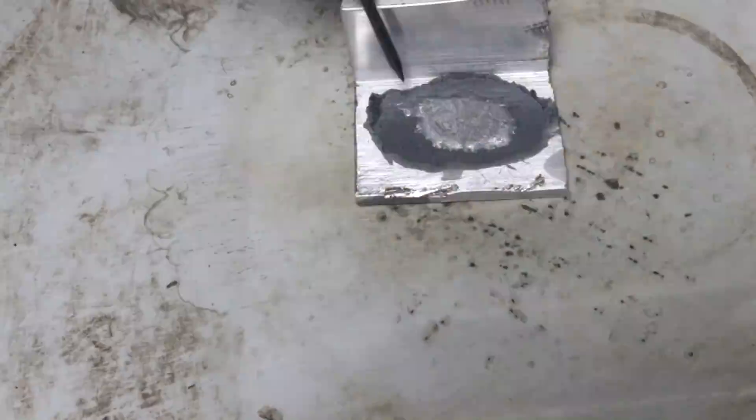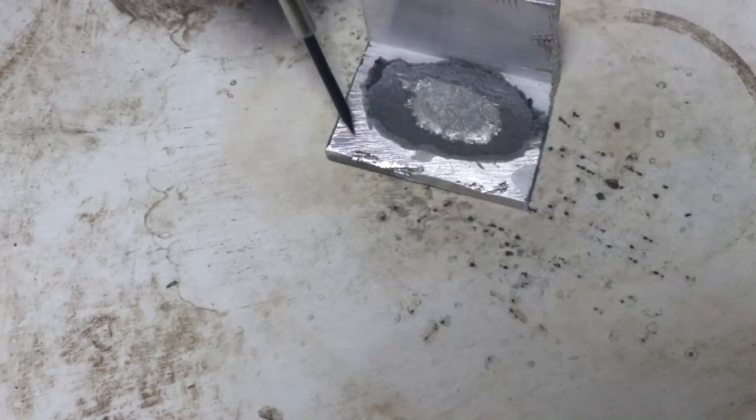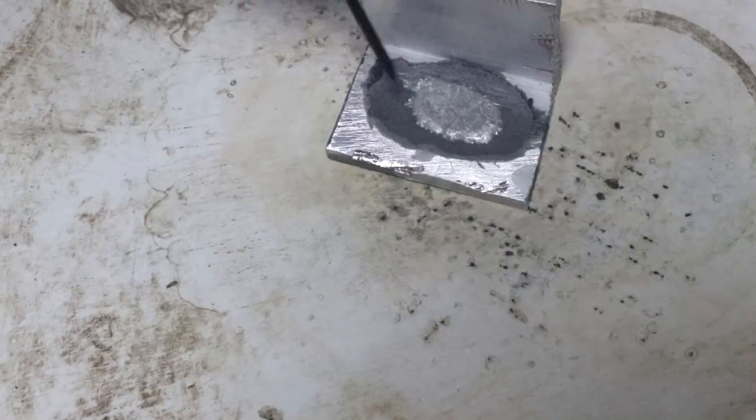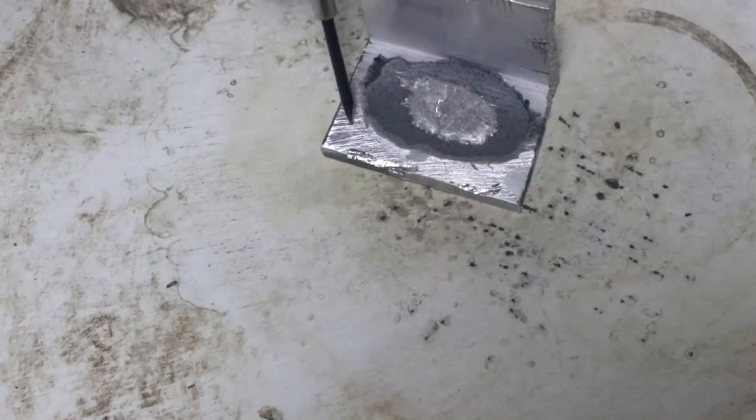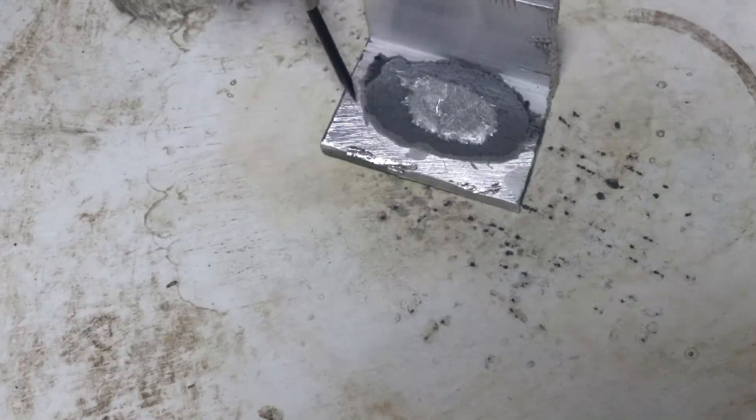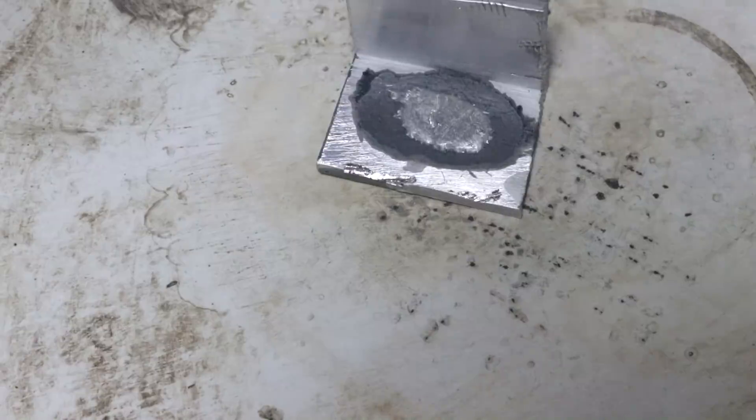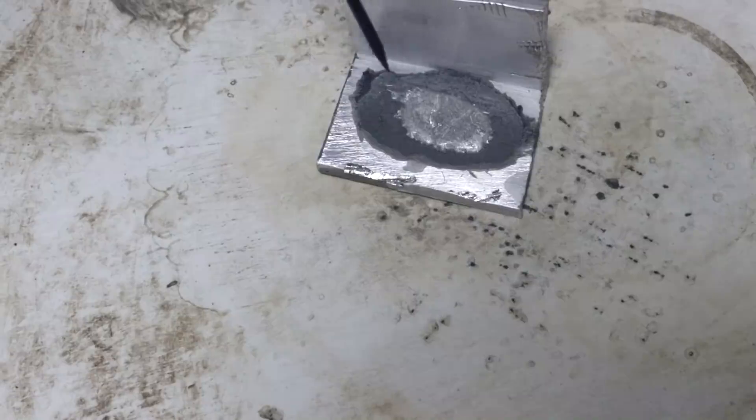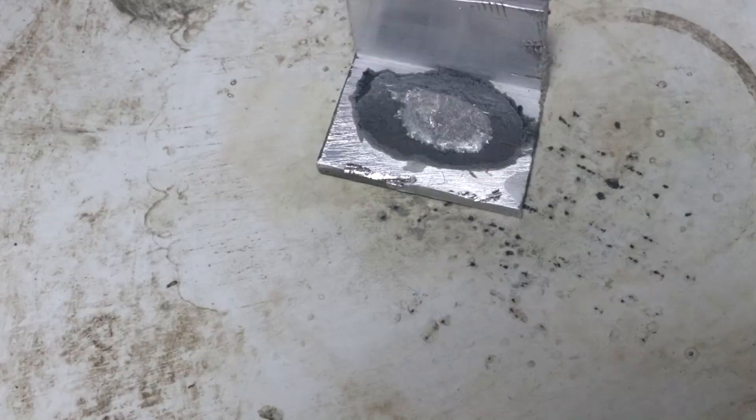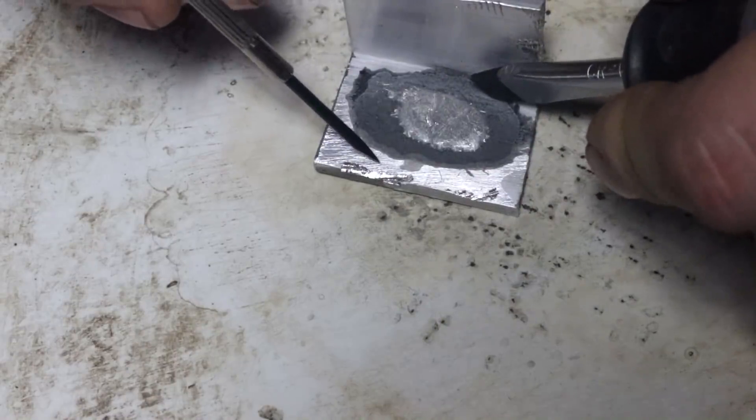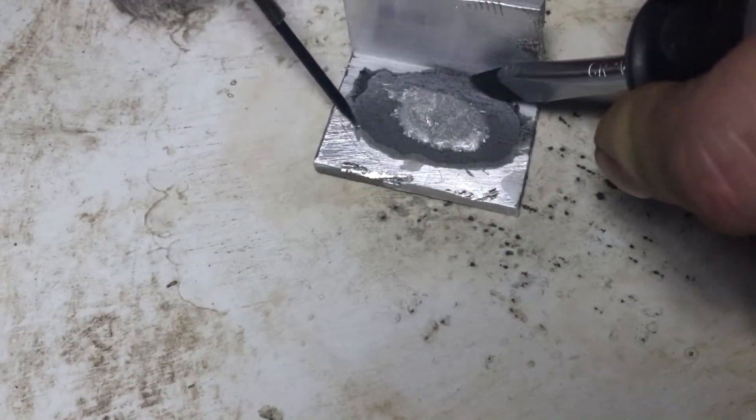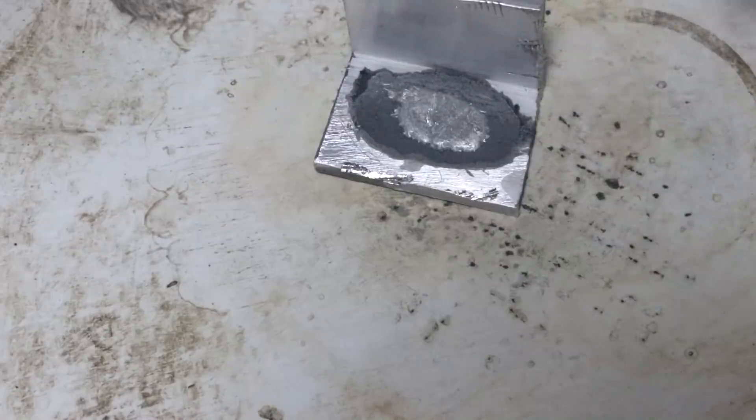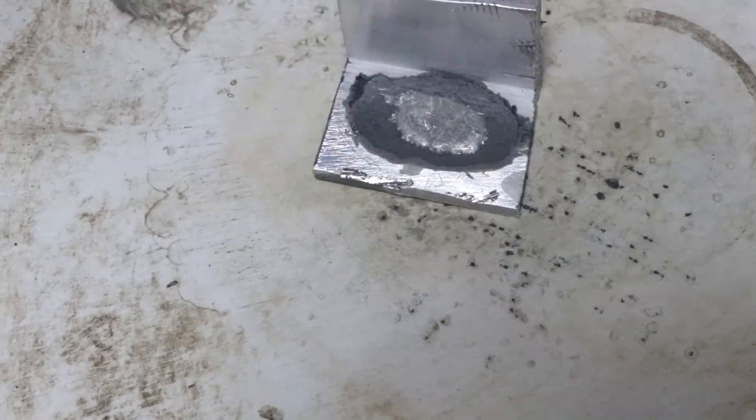Okay, just after 5:30, so you can see that there is a little bit of a different colored silvery gray outline around this dark gray mark. The aluminum isn't being oxidized substantially. It's not until I cool it off that it starts to really destroy it. So maybe doing a thermal cycle would be more effective. So let's actually turn the hot plate off. Let's let it cool down again and see if that works. Let me kind of mark it where the outline of that area is and then where this currently is. But if anyone has any idea why it causes the aluminum to really fall apart when it's cooling off, please let me know.